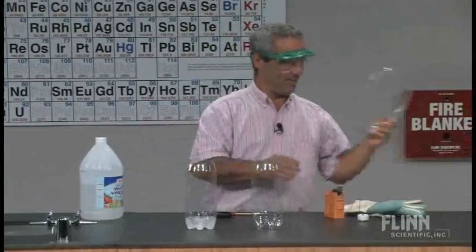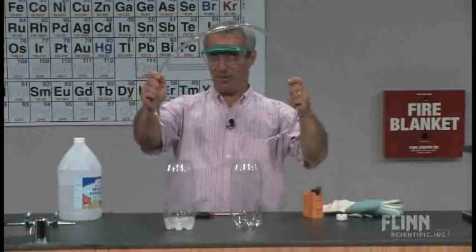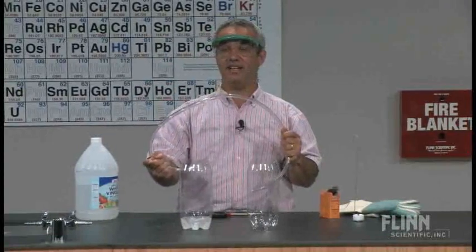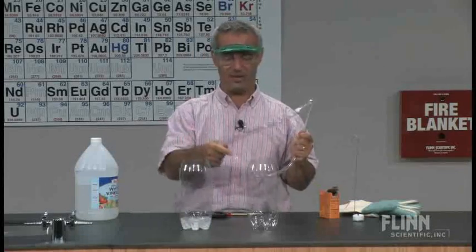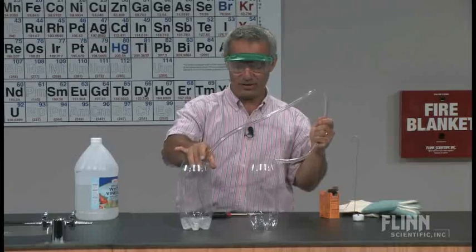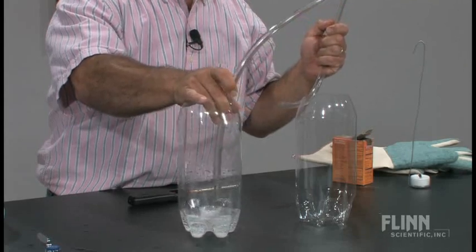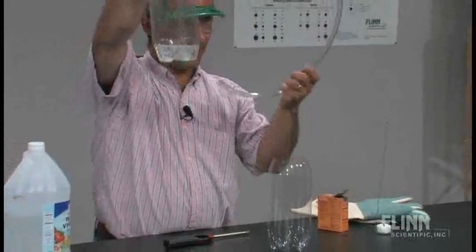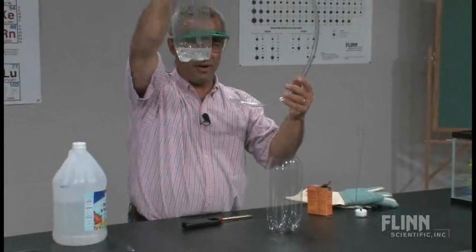Let's siphon. Okay are you ready? You saw me pour it. Let's try to siphon it. Now a couple things about a siphon. One is you have to siphon downhill not uphill so I have to raise this one above the other one and you have to prime it. Okay so here we go. I'm putting this tube down to the bottom of the CO2 but it's not into the liquid. Got to be careful about that.